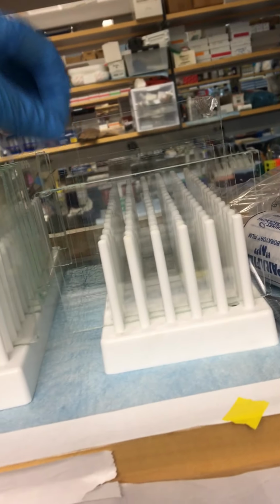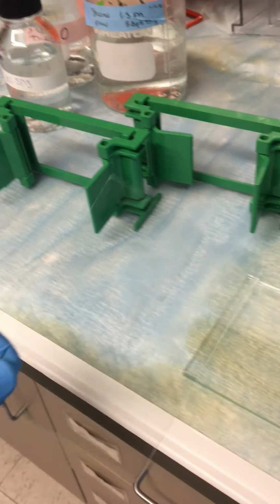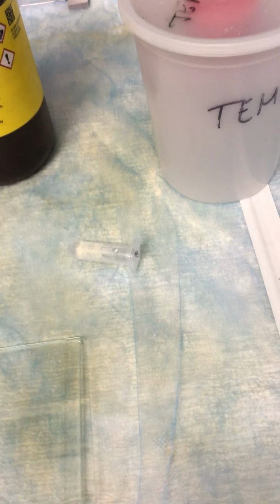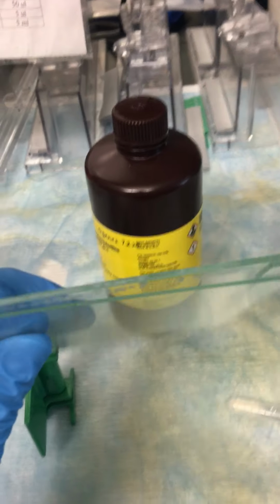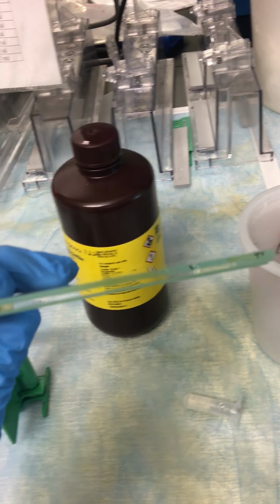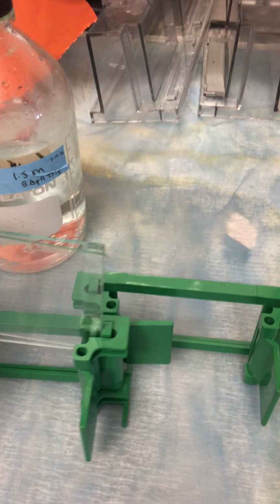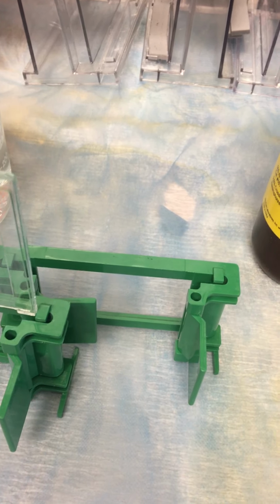And then you also want one of these thin glass plates. It's so hard to see this on a camera. So let's see if I can do this one-handed while also holding a phone. You're going to put these together to create this little sandwich, and then you're going to put it into the green. Normally I do this with two hands, so it's a little bit easier.